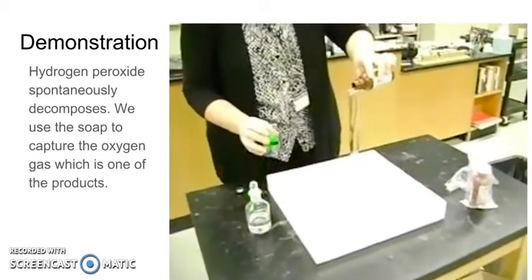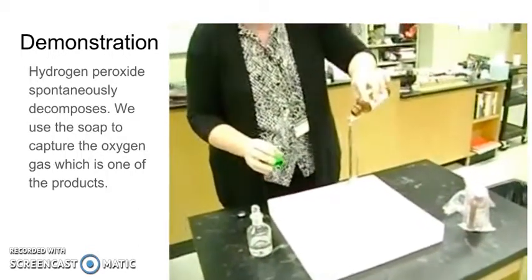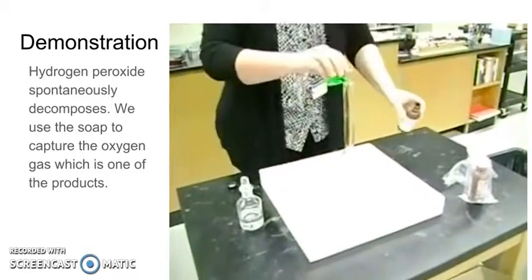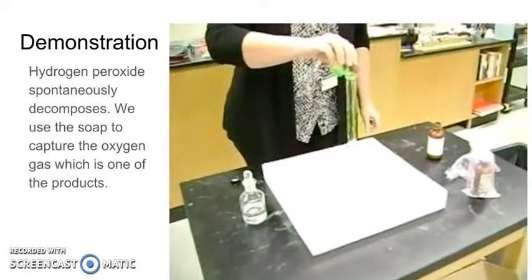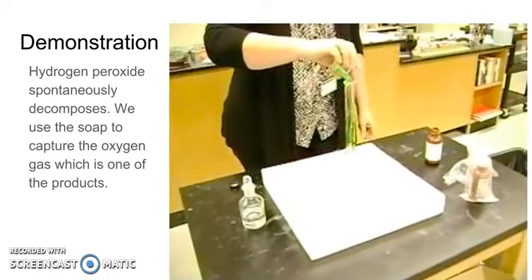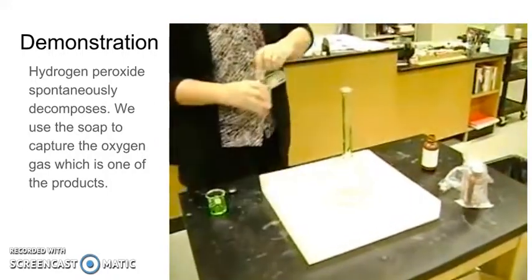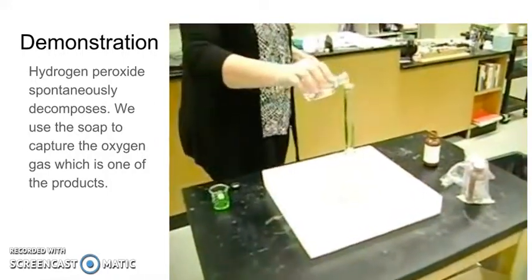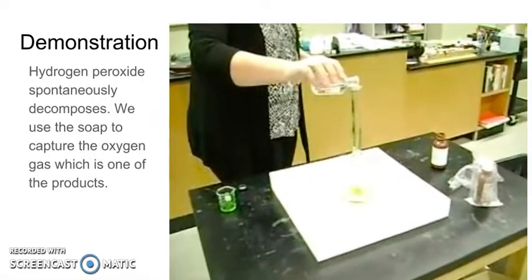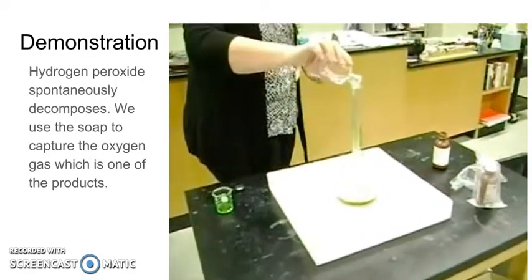Add the hydrogen peroxide — hopefully not spill it. This is soap. And then we add... see, nothing's happening, right? Well, something is happening, you just can't see it. Now we're going to catalyze it.